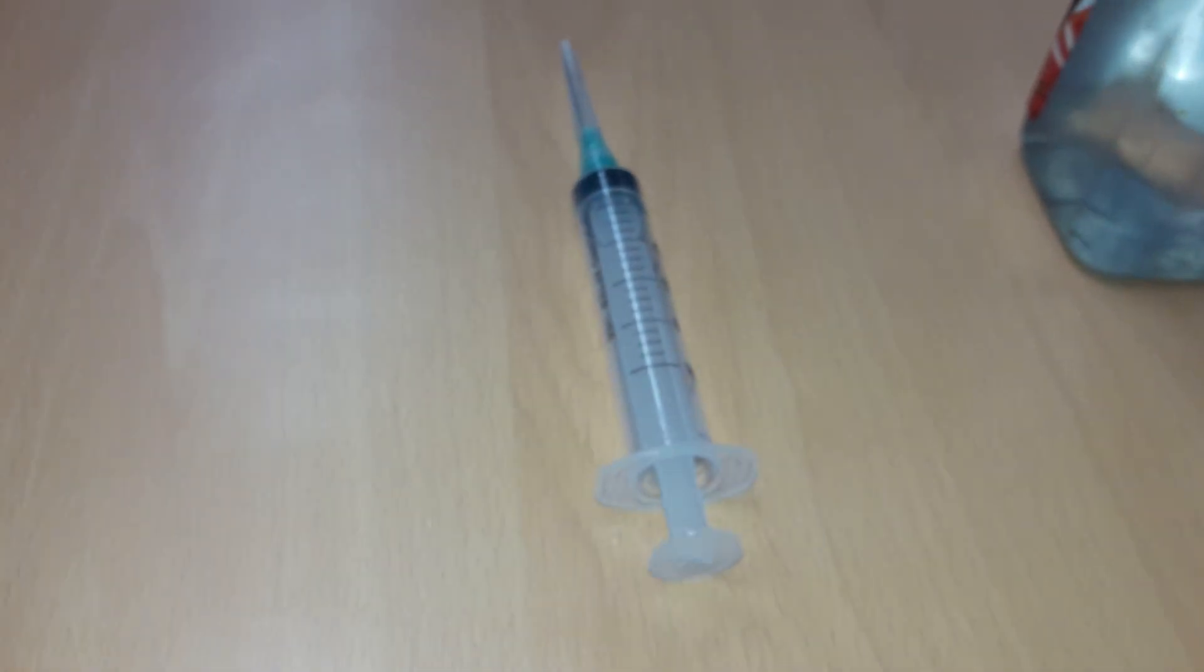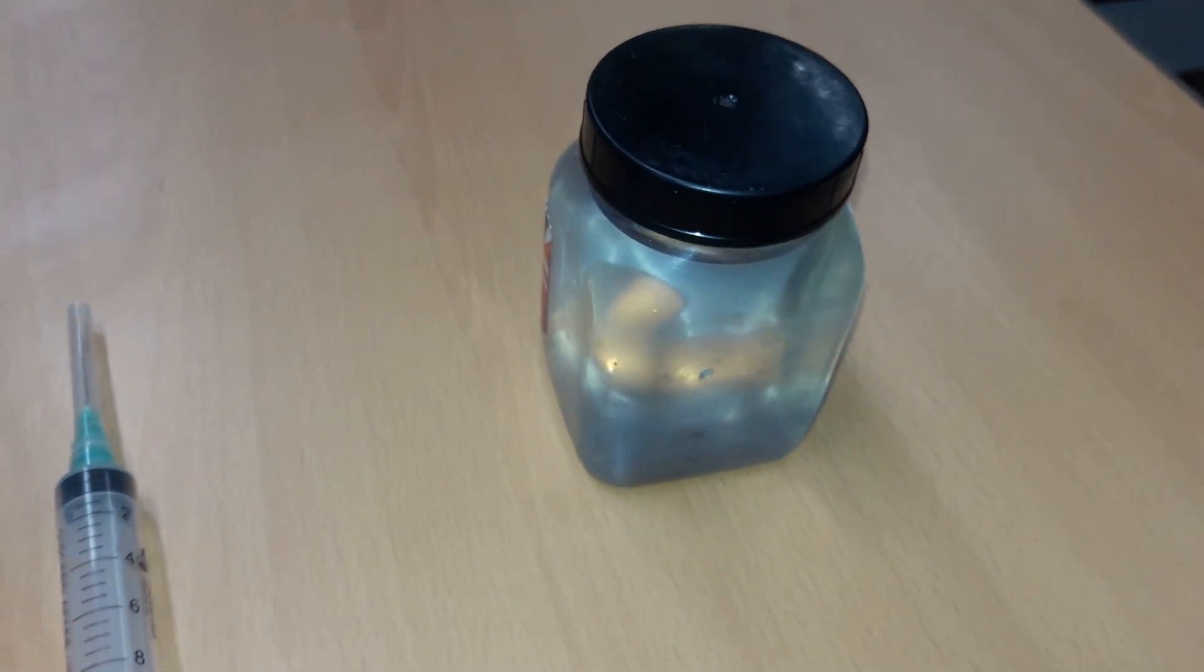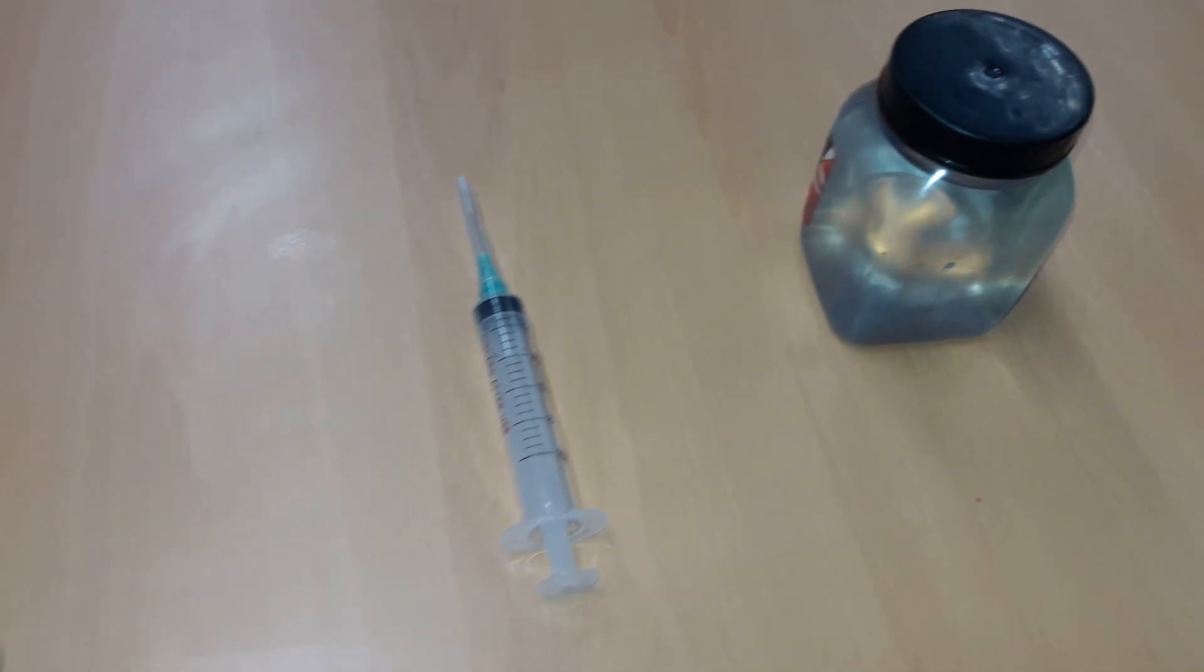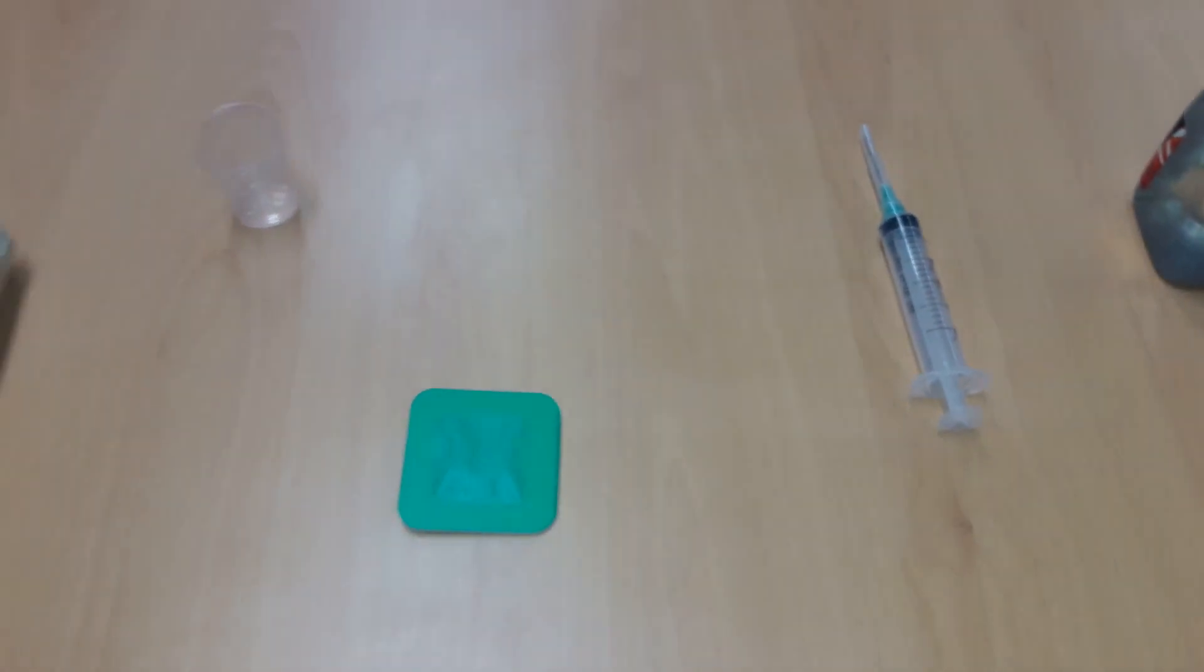Reusable Syringe. Solvent chosen as a function of the surface contaminant to be determined. For determination of water-soluble contaminants, use distilled or deionized water.